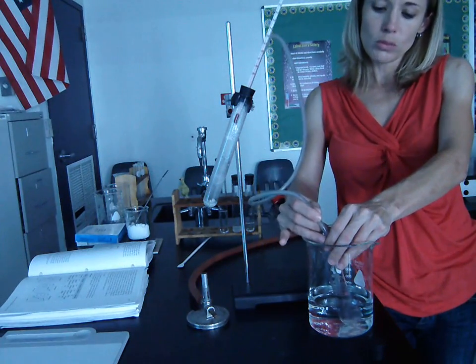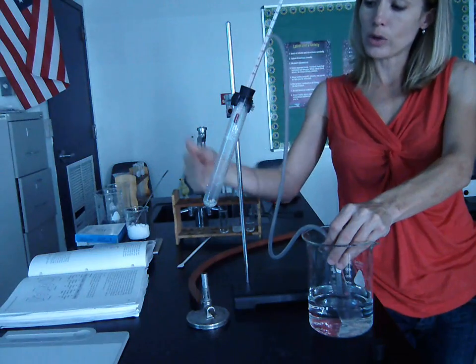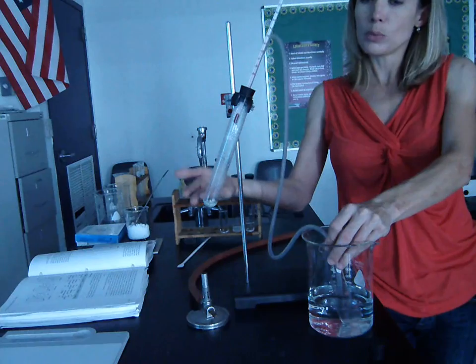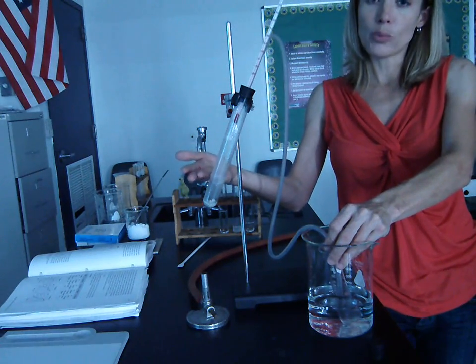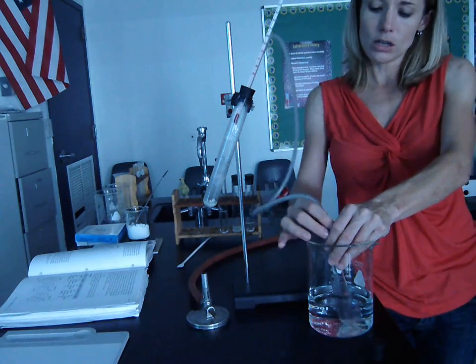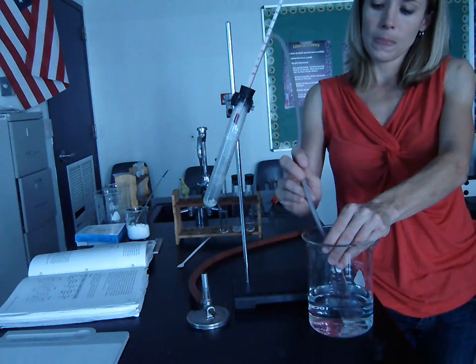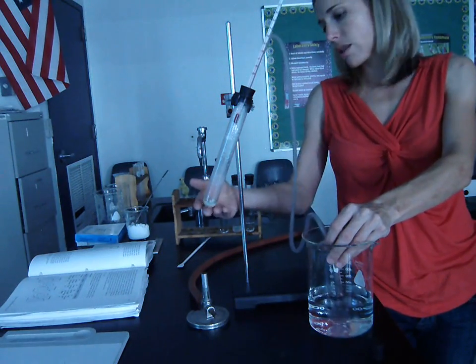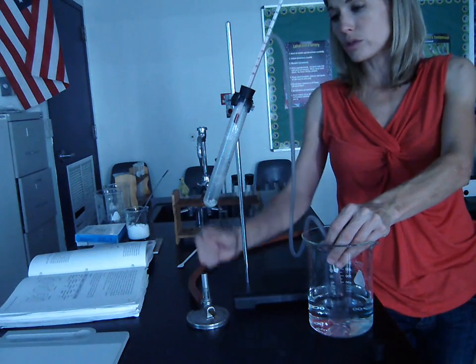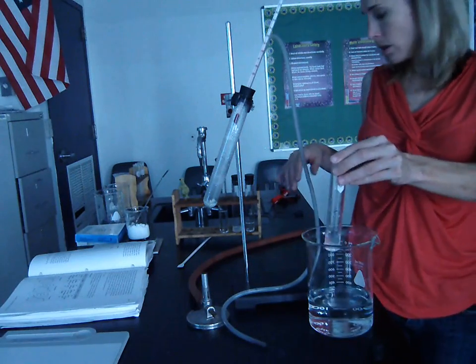So we leave the delivery tube here. We notice, again, the temperature stays exactly the same the whole time that the water is boiling, because that's its boiling point, and we know that when a substance boils, its temperature stays constant for a period of time. So the temperature stays constant at 100, and we leave the delivery tube over here, collecting all the water. Once it appears that we're pretty close to dryness, meaning we've boiled off most of our solution, then we can remove the delivery tube and turn off the Bunsen burner.